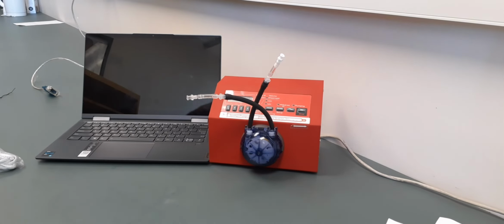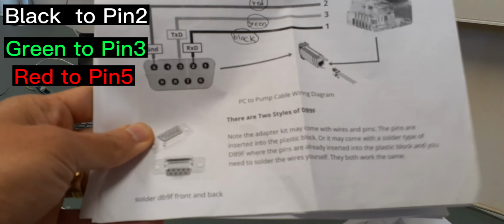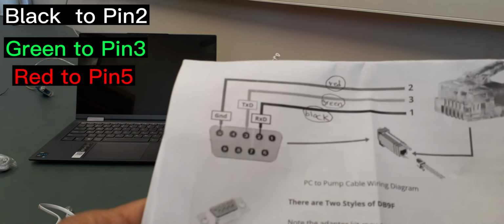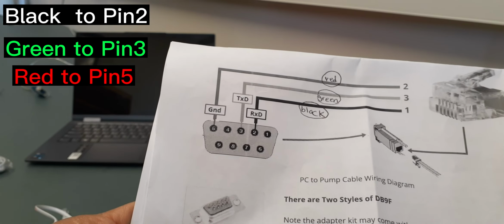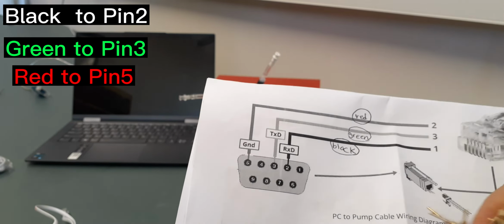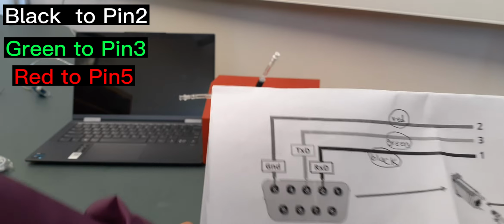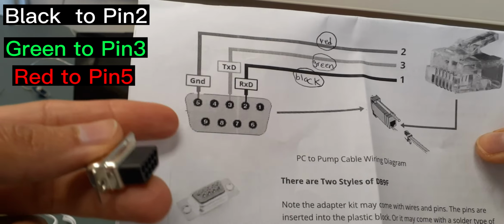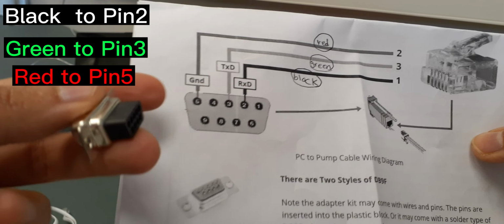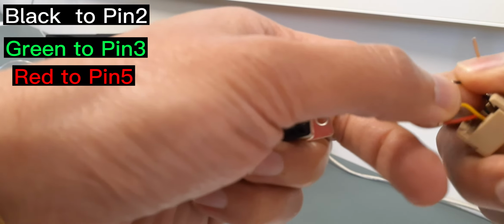So let's make that. Based on the instruction, which is very useful, it says the black cable of this adapter should go to pin 2 of this one, and the green one should go to pin 3, and the red one to pin 5. So you just push these ones. So the black goes to 2.